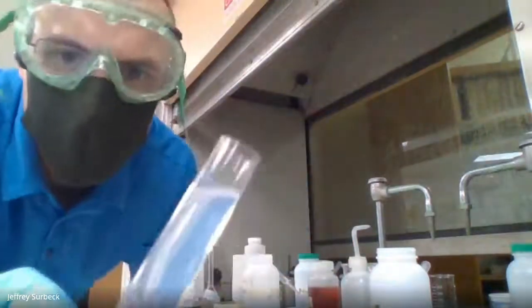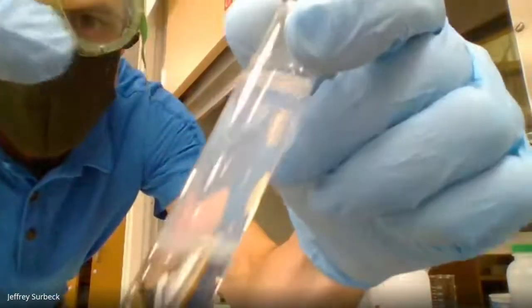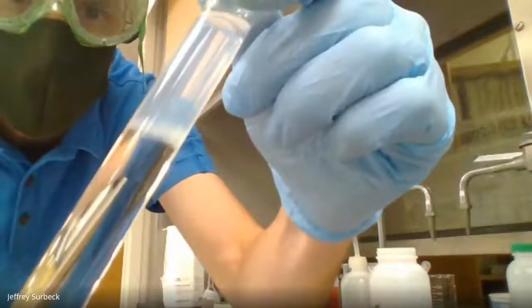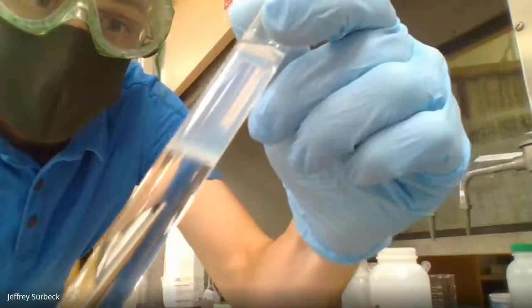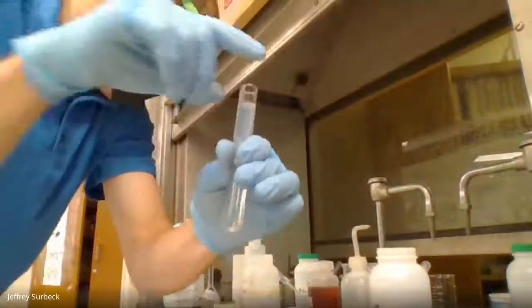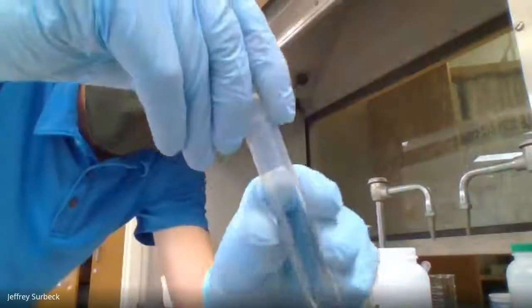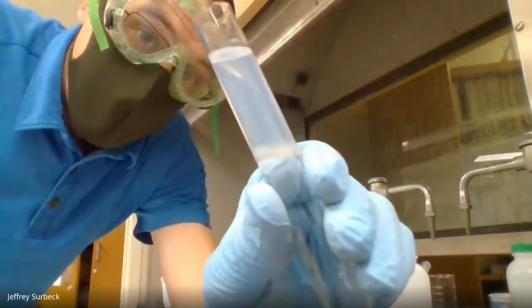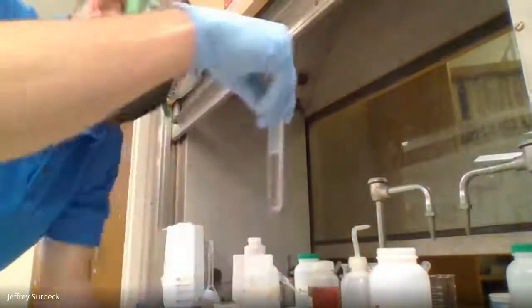Okay, so check out what's happening. This top portion is what you should be recording, right? It's turning back to that cloudy solution. So this was by adding potassium iodide to this particular solution. Again, it went back cloudy. That should be number 17 in your report sheet. Should look like what we have on the top portion, a cloudy solution, that is, a precipitate has occurred there.